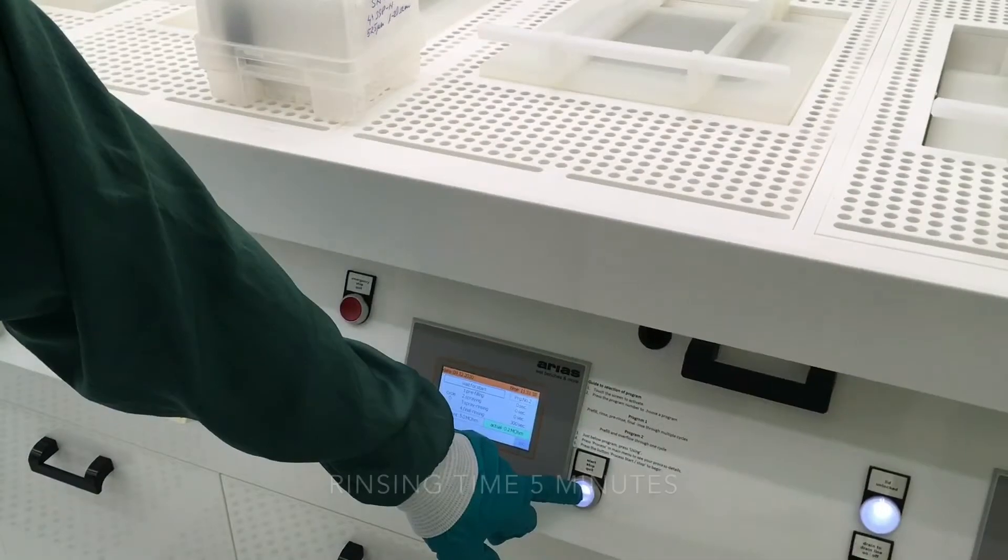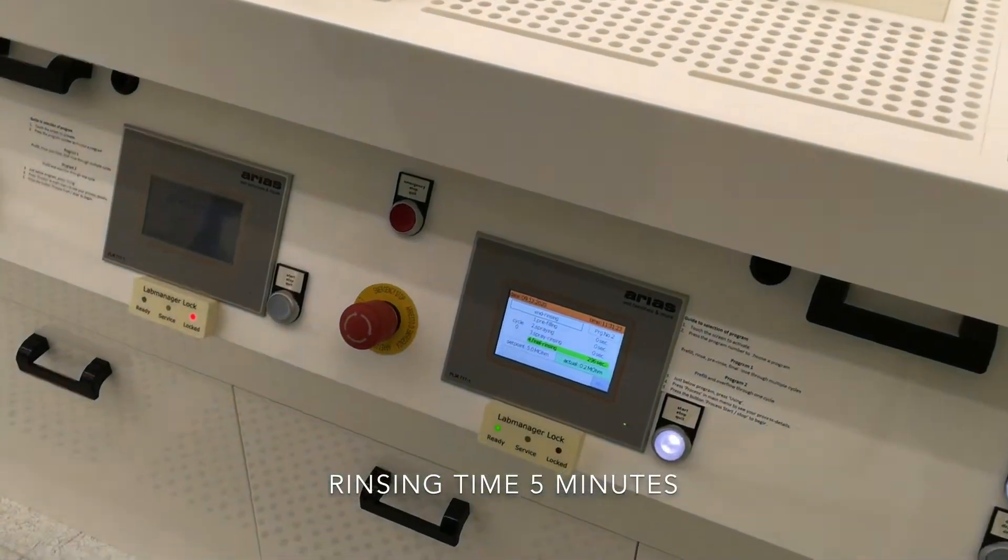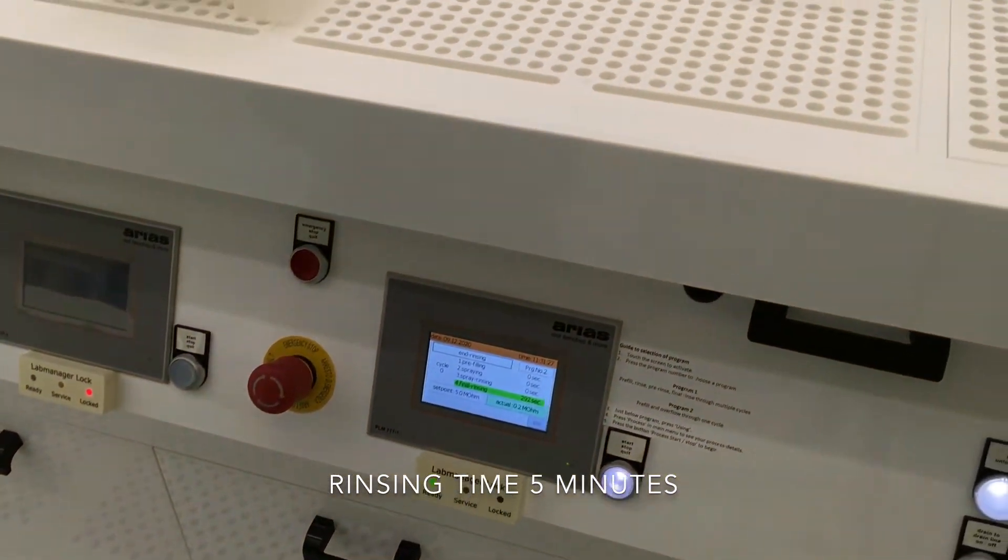We then turn on the rinsing, and the water will now rinse the wafers in approximately 5 minutes.